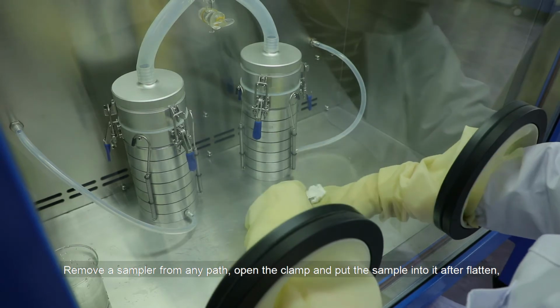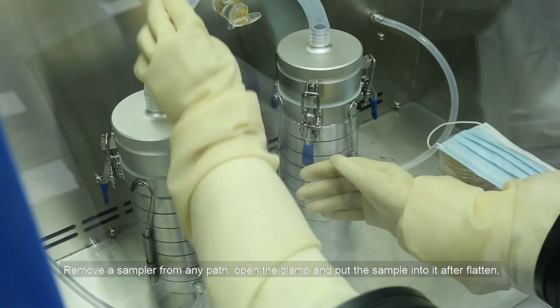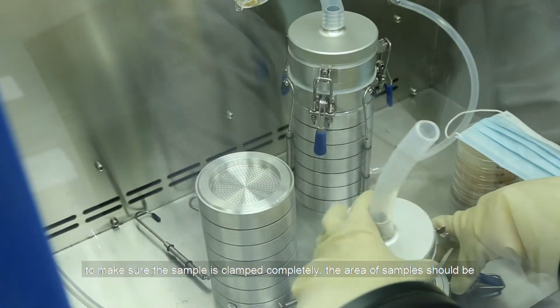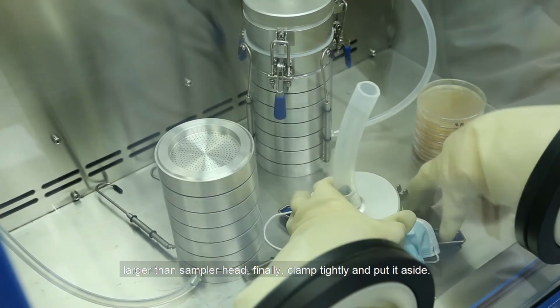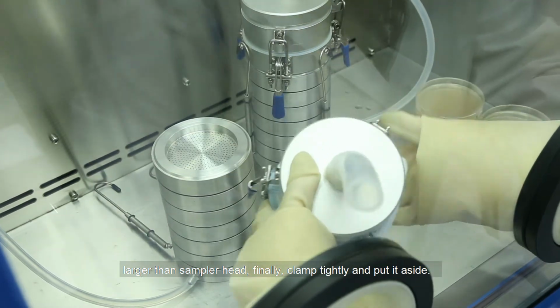Remove a sampler from any path. Open the clamp and put the sample into it after flattening. To make sure the sample is clamped completely, the area of the sample should be larger than the sampler head. Finally, clamp tightly and put it aside.